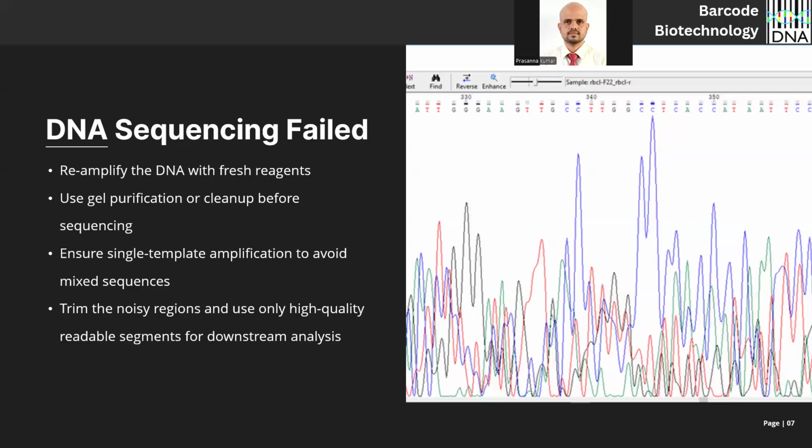Many times Bacillus subtilis and cereus form a translucent colony around, with Lactobacillus and many more bacteria. They coexist. So if you pick such colonies and go for DNA isolation, you will get a sharp band in PCR, but only after sequencing, by observing the noisy chromatogram, will you see the problem. This is simply because of 2-3 species. The amplicons of 2-3 species are actually forming a background noise. This is a very clear-cut indication that it is a mixed culture.